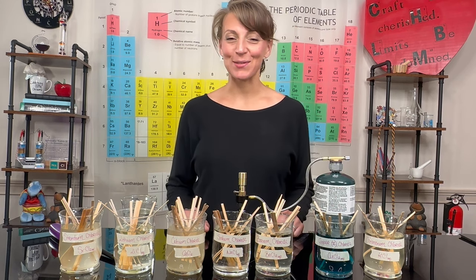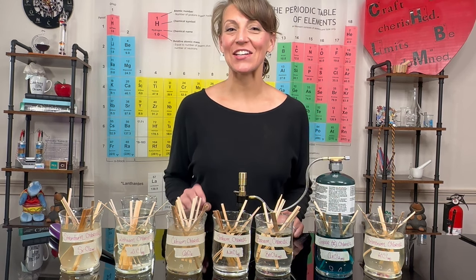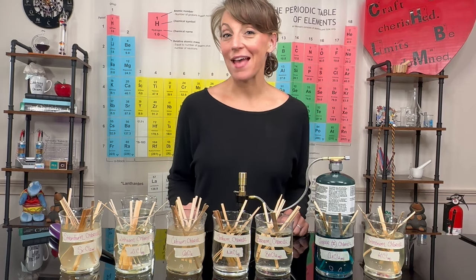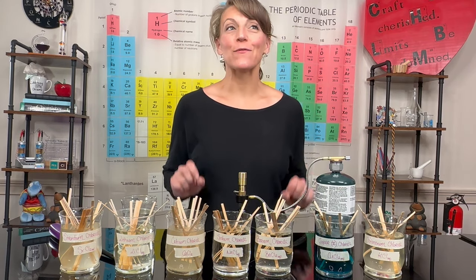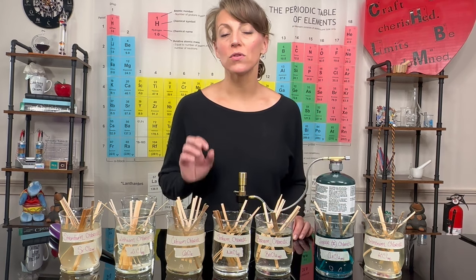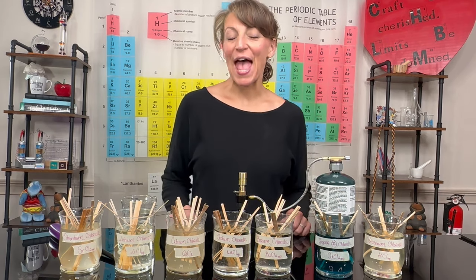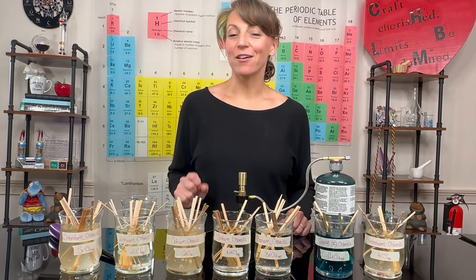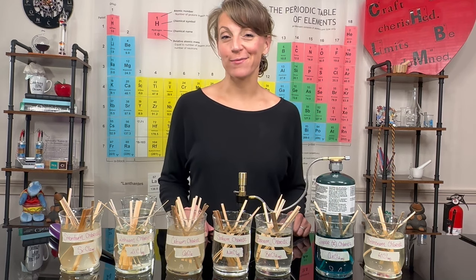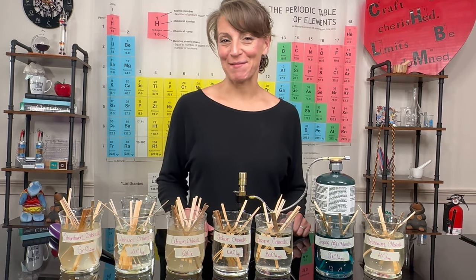Welcome to ChemCamp. I'm Mrs. Newman, and in this video we're going to take a look at the classic chemistry experiment known as the flame test. It's a phenomenal little lab that allows you to observe an array of delightful colors and even helps explain some of the chemistry behind a fireworks display. So let's learn a little chemistry.